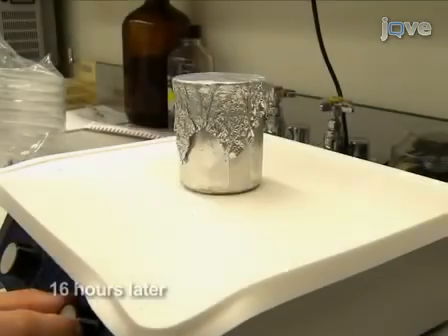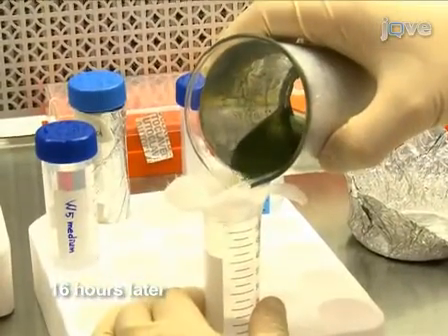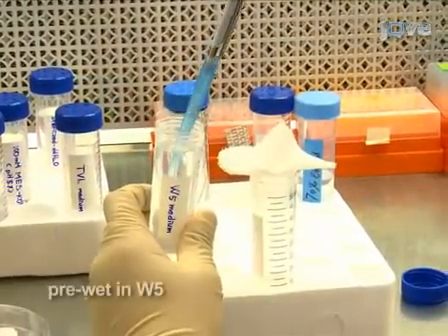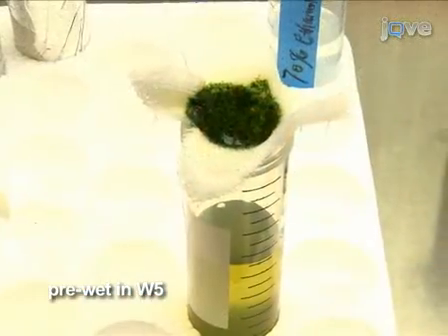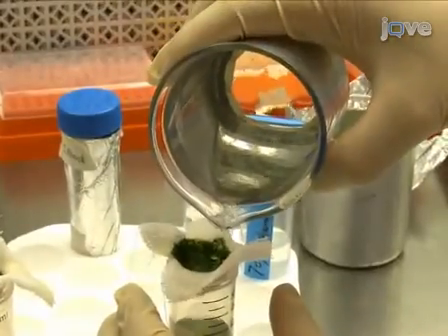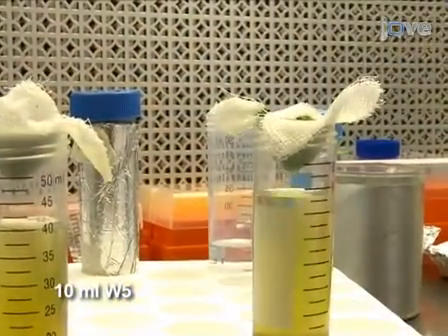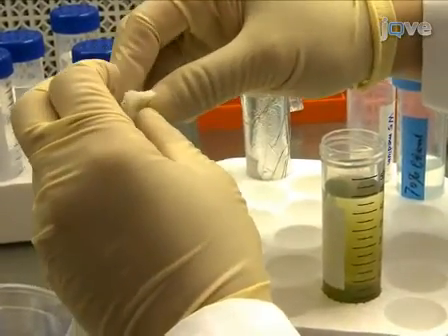At the end of the incubation with the enzyme solution, collect the released protoplasts into a 50-milliliter Falcon tube by sieving the mixture through 8 layers of cheesecloth pre-wetted in W5 solution. Sieve the remaining protoplasts by washing the cheesecloth slowly with 10 milliliters of W5 solution. The protoplasts are now collected in the Falcon tube.